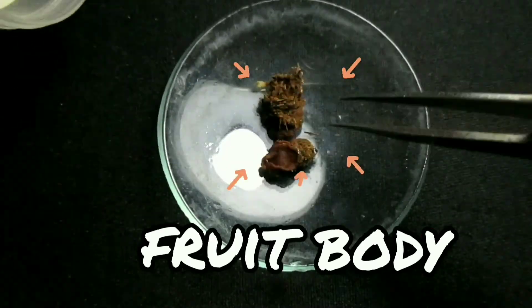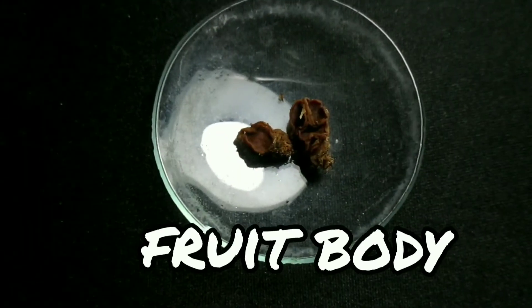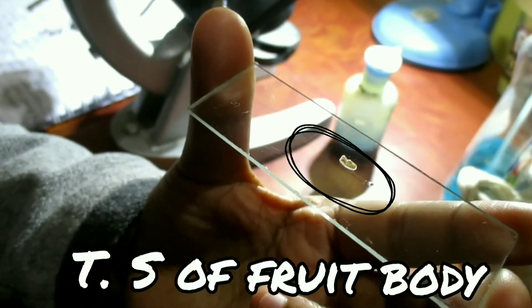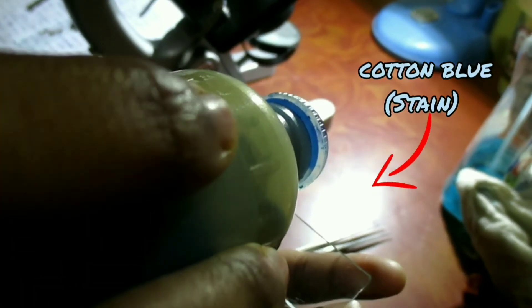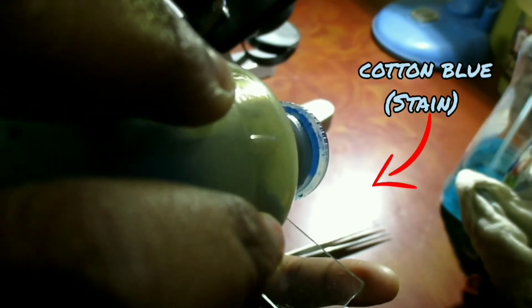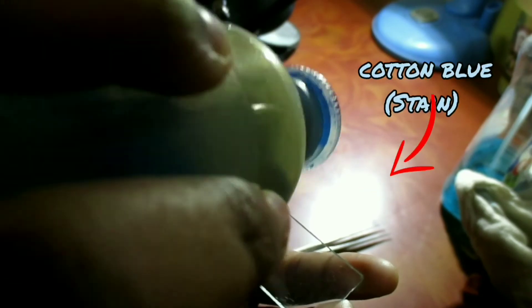We need a grease-free glass slide, a pith — I usually cut without using pith, but I suggest you try to cut fine sections using pith according to lab procedures — the fruit body itself, a sharp new blade, and cotton blue as stain.